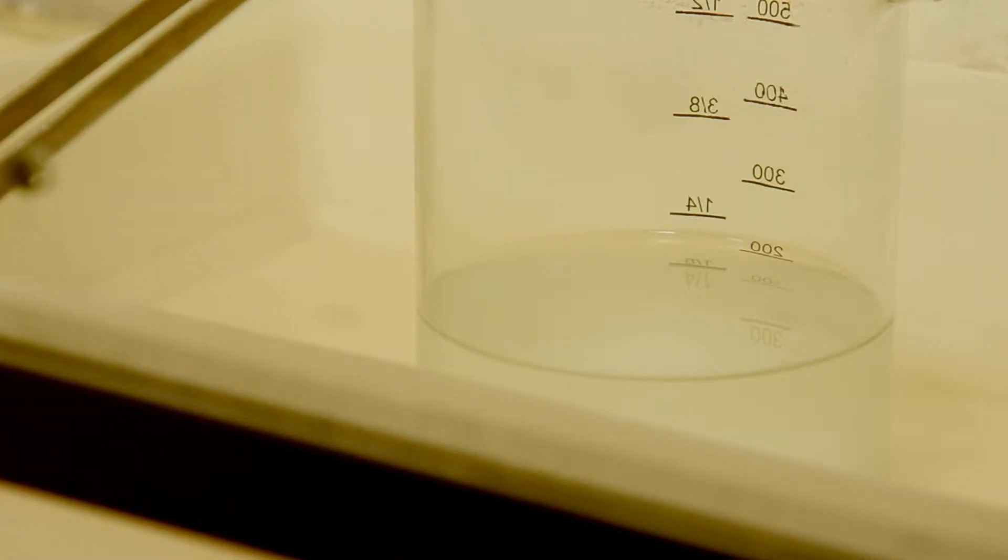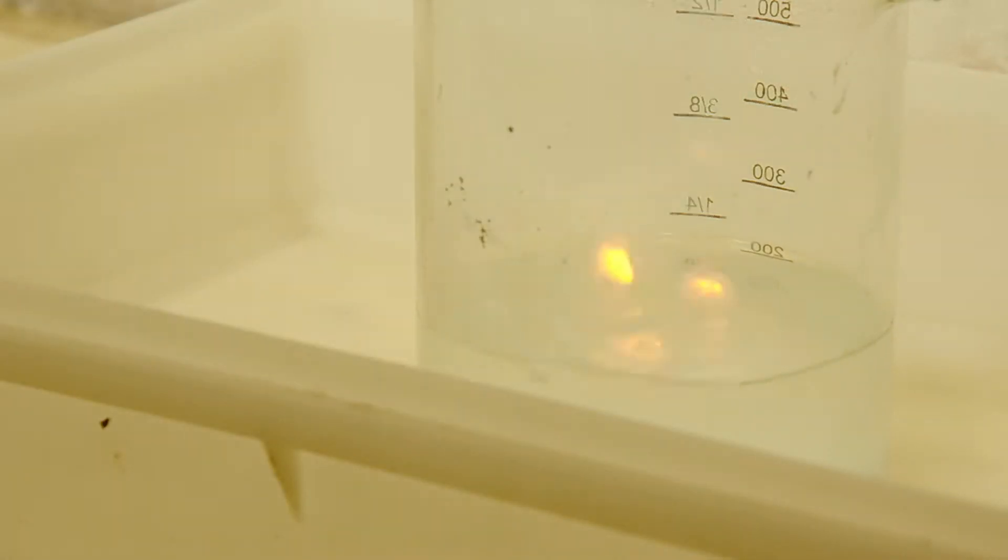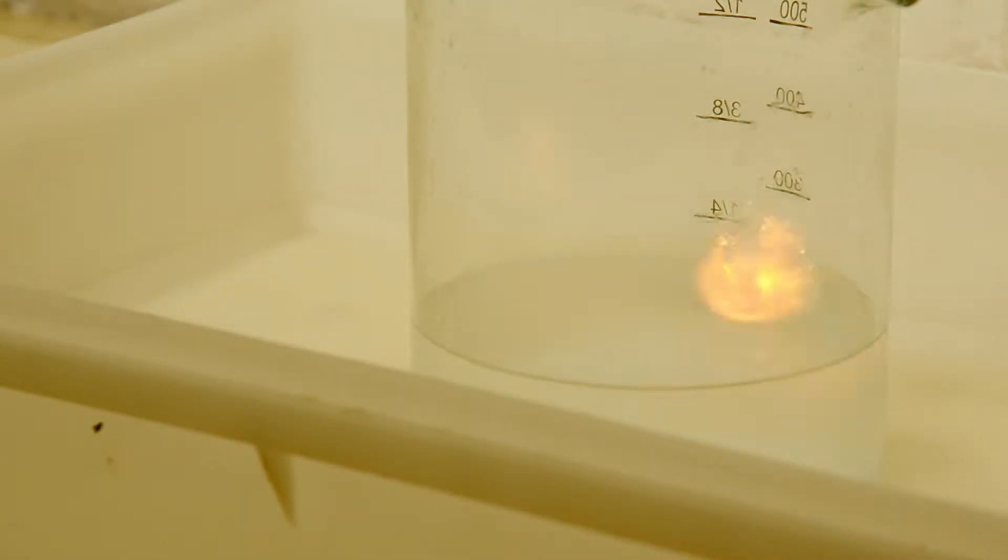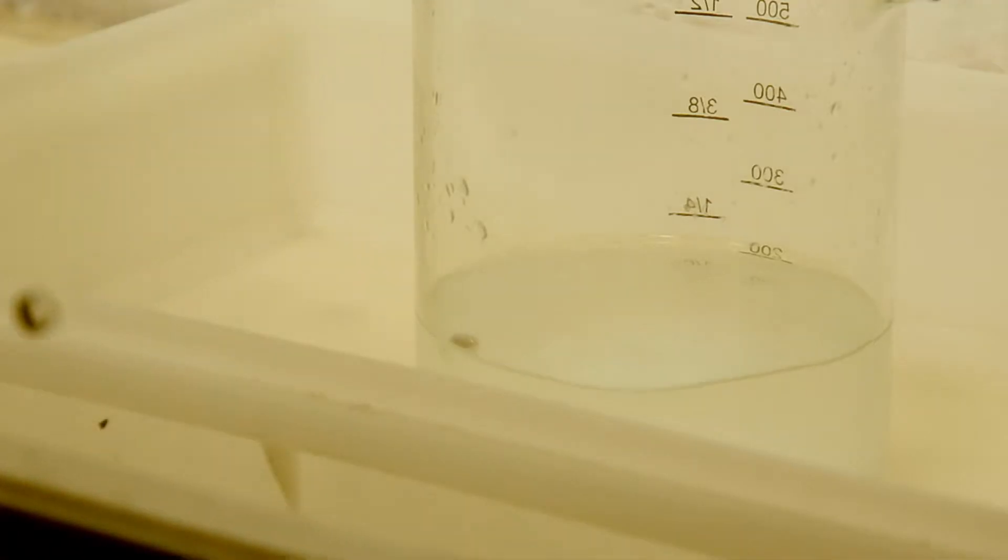You all know how sodium reacts with water. It's kind of a must-do for every chemist. So I also took a closer look at the reaction, but mainly to confirm Thunderf00t's experiments.